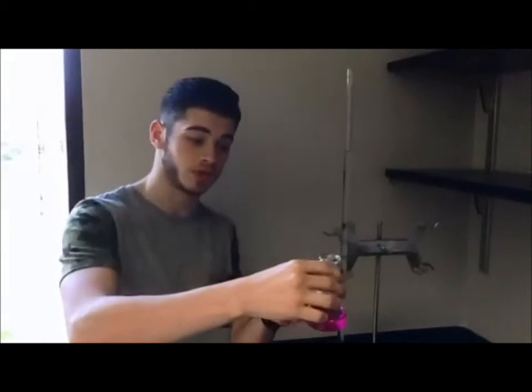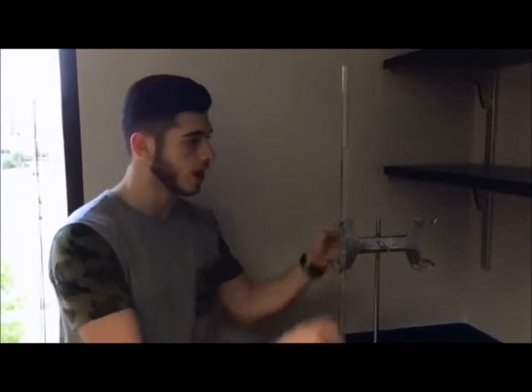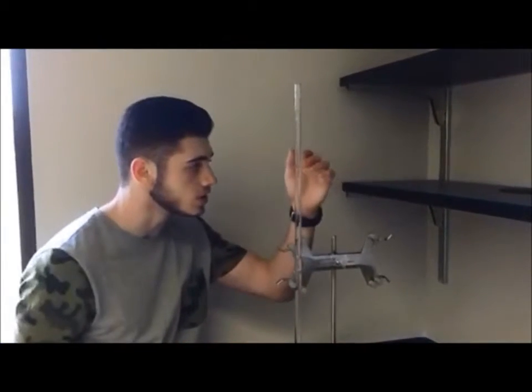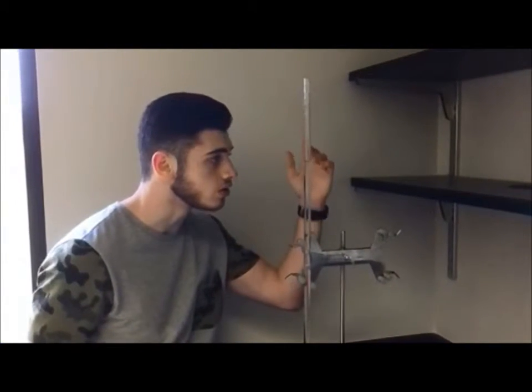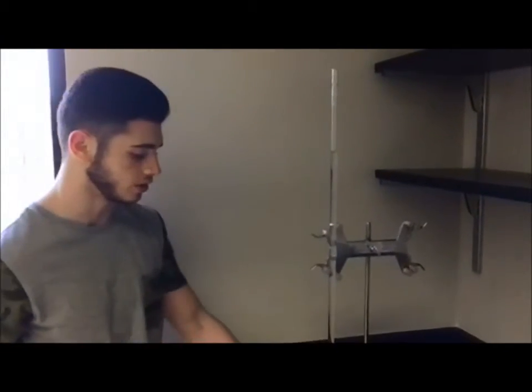And what that means is that the moles of the acid are equal to the moles of base. So once you get to a very light shade of pink, that's when you stop. This is an example of when you've gone too far. So after doing this, you go back and you record your final volume, which is 10.03 for example, and that'd be it.